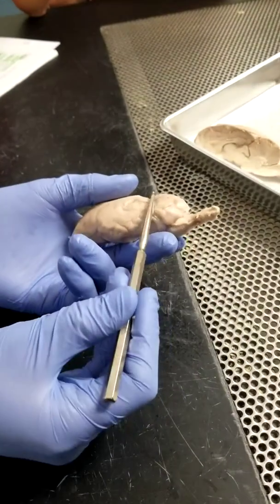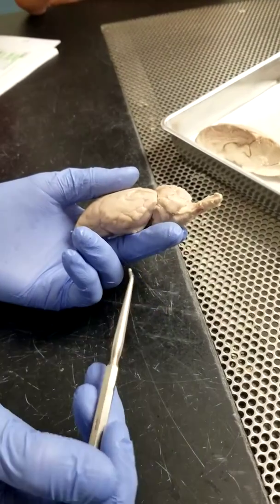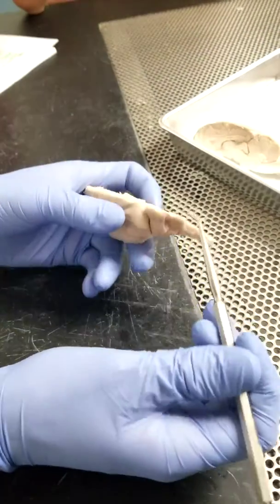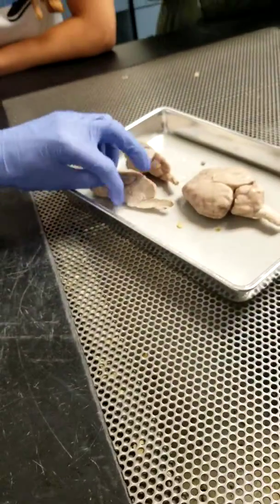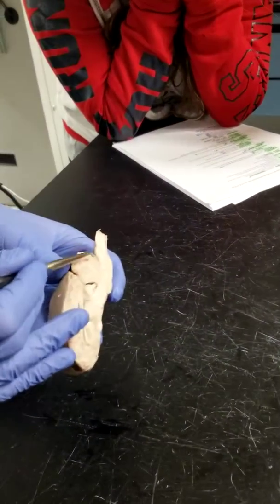Okay. One thing we didn't talk about was our cerebellum superficially. So we've got our cerebellum there. If you look inside of it, that's where you can really appreciate the arbor vitae of the cerebellum, that tree of white matter coming through the gray matter.